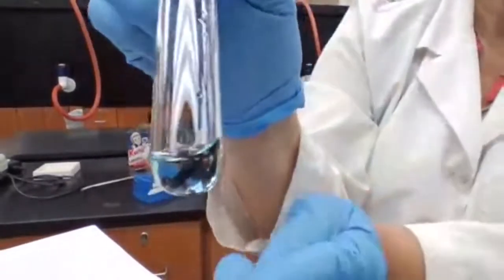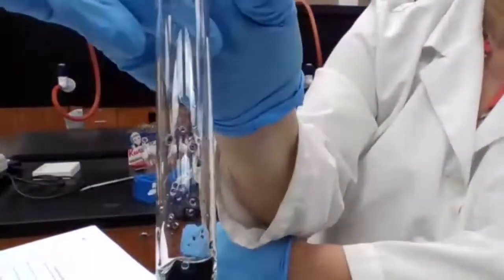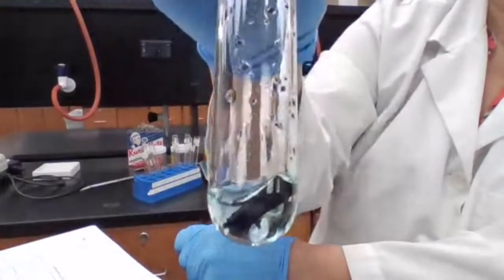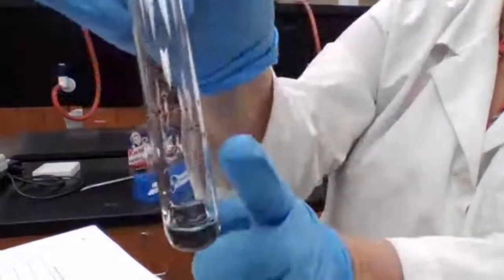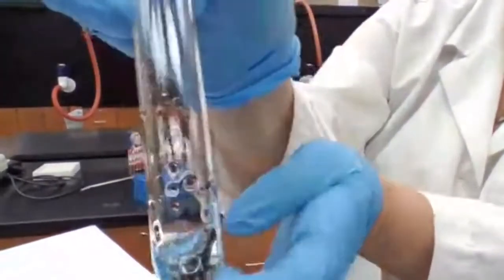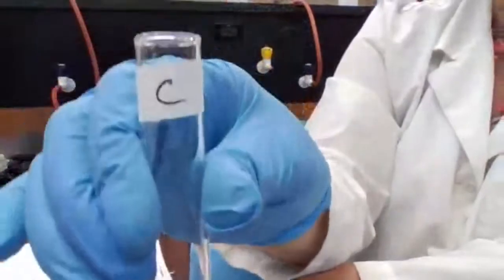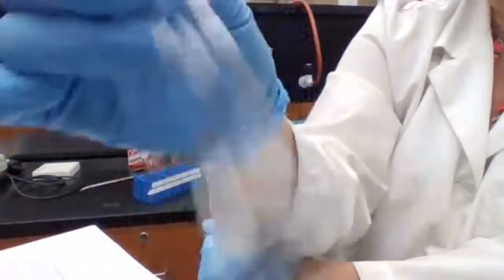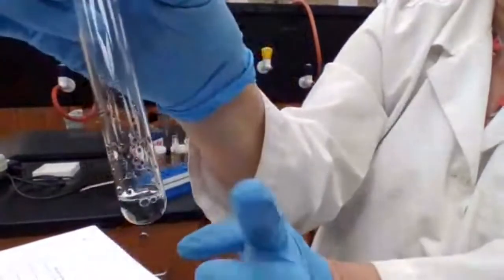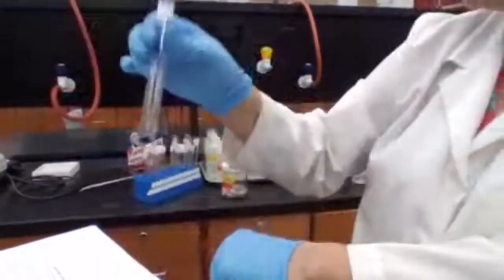Test tube C is zinc with copper sulfate. You can see the color change and particles in the test tube — that's the evidence of a reaction. Those are pieces of copper coming out, and zinc is going into solution. We see red color particles of copper coming out. For test tube C, there is a reaction. The metal ion was copper, the metal added was zinc, and there is a reaction.